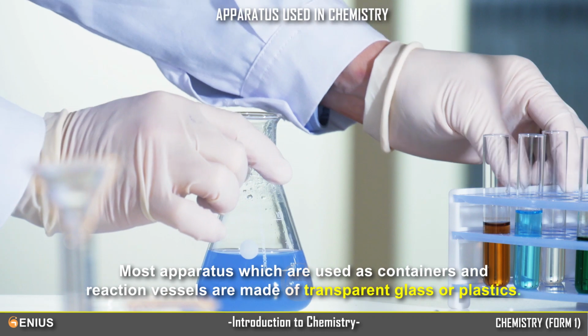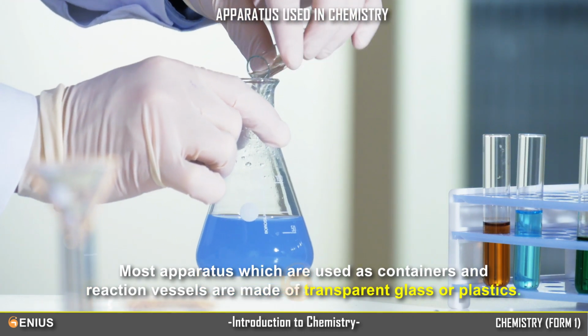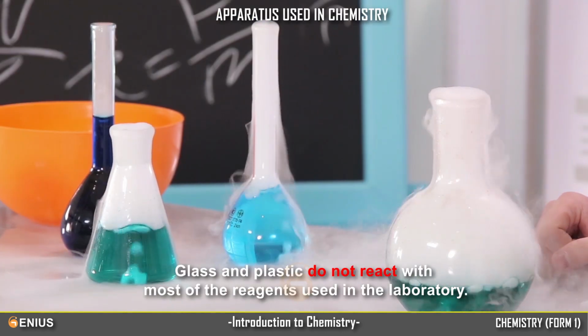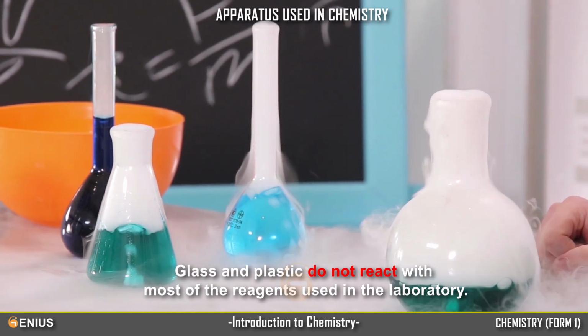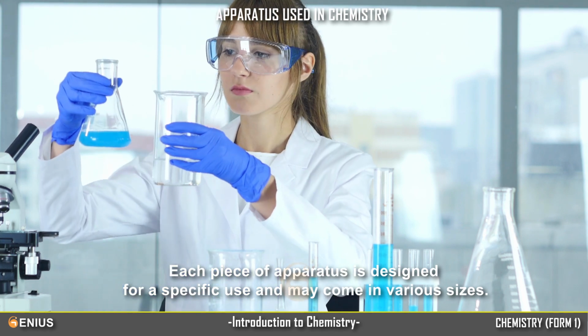Most apparatus, which are used as containers and reaction vessels, are made of transparent glass or plastics. Glass and plastic do not react with most of the reagents used in the laboratory. Each piece of apparatus is designed for a specific use and may come in various sizes.